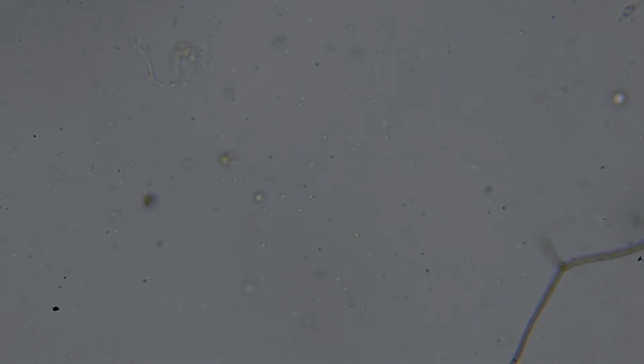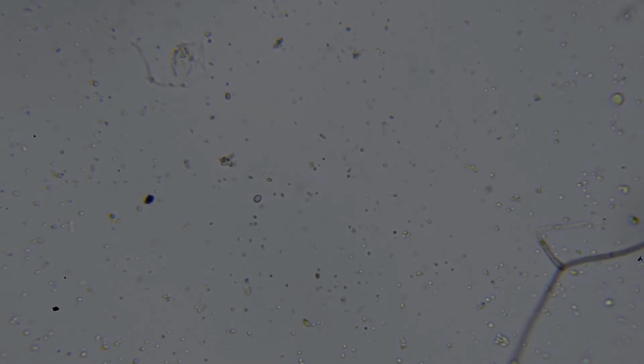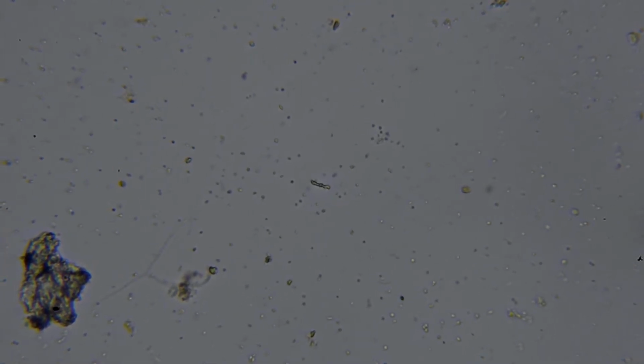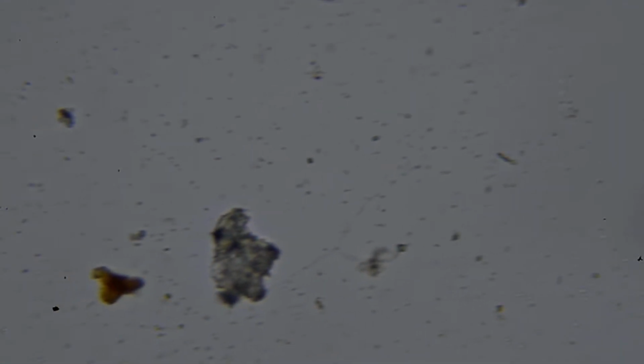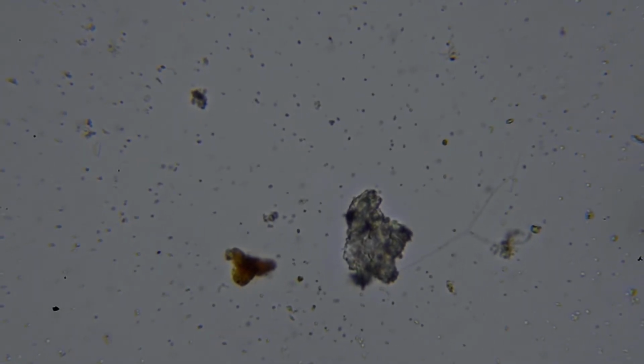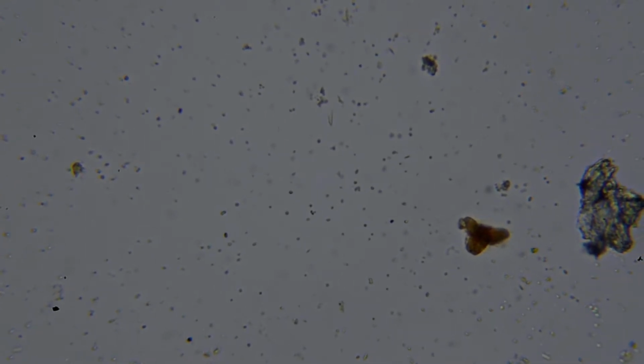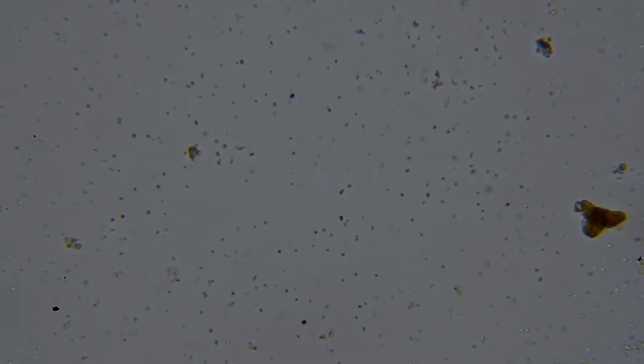We can see that there's not a huge variation in the shapes. We're looking for about 14 different shapes, which gives us a representation of the diversity of species of bacteria. There's of course millions of species of bacteria, but 14 gives you a good indicator as to variation. So we can see little singular dots that just look like full stops, and they're cocci. Anything that is rod-shaped is a bacillus.